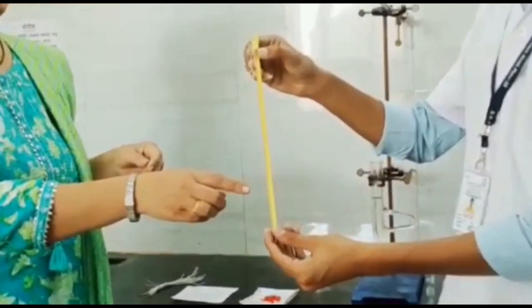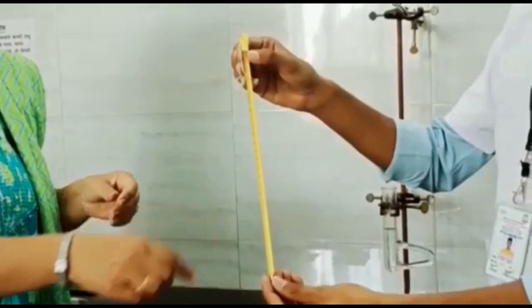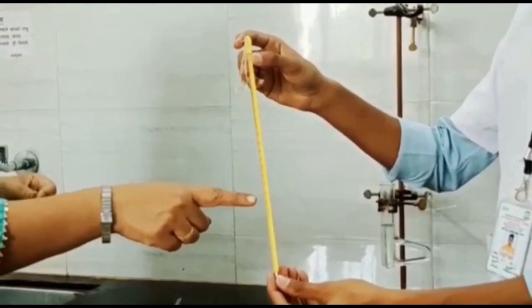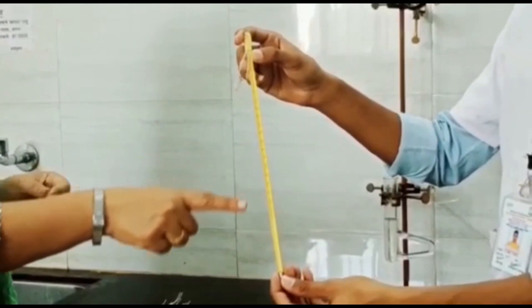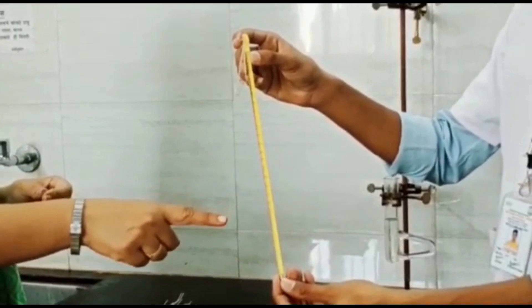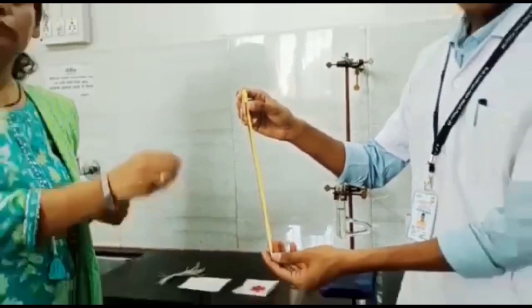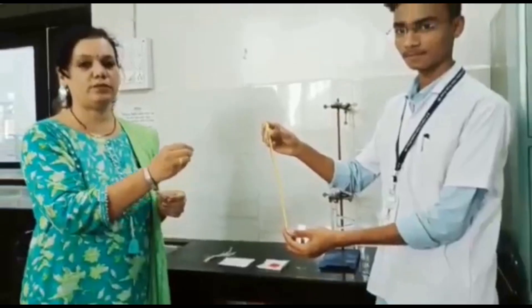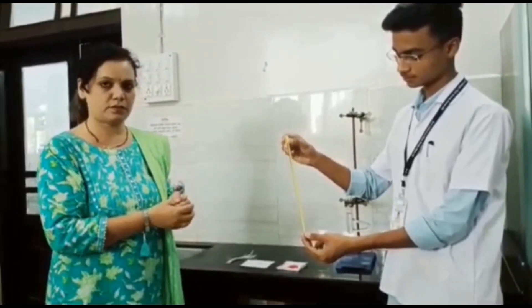Check the temperature on the thermometer before using the assembly. Try to read the temperature on the thermometer so that you are able to note down the exact melting point temperature of the given substance.